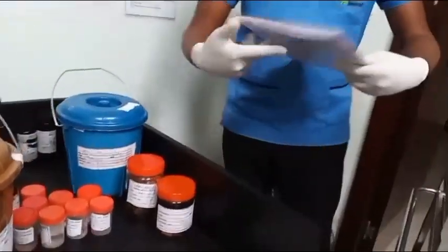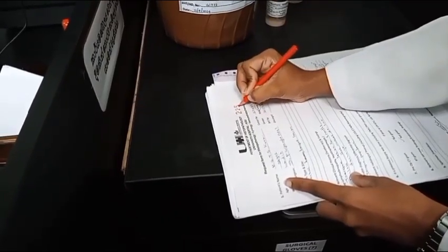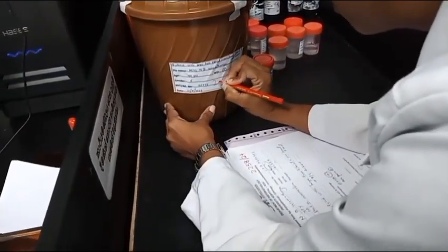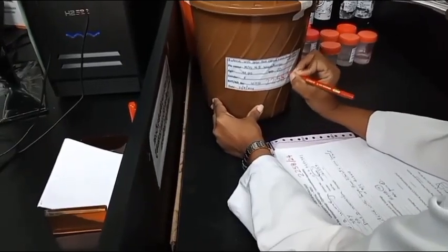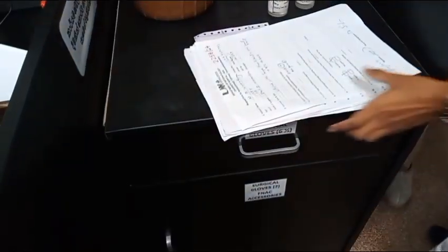The specimen should be in a clean, adequately sized container with a wide mouth and a well-fitting lid. The specimen container should be labeled with the patient's name, age, gender, BHT clinic number, ward, name of the specimen, and date of surgery. The information given in the request form should conform to the details on the label.